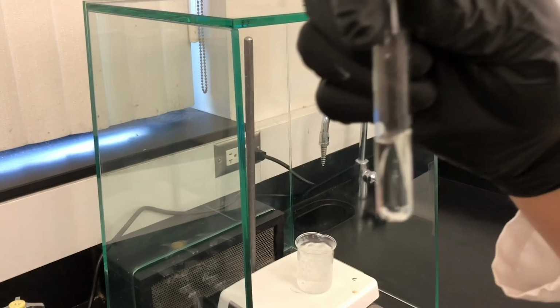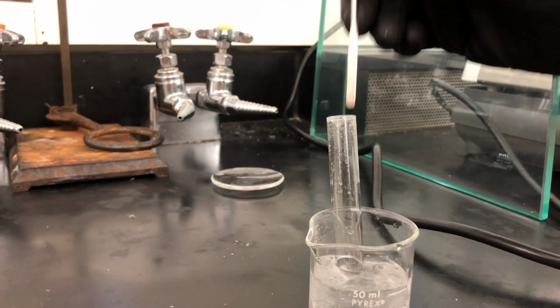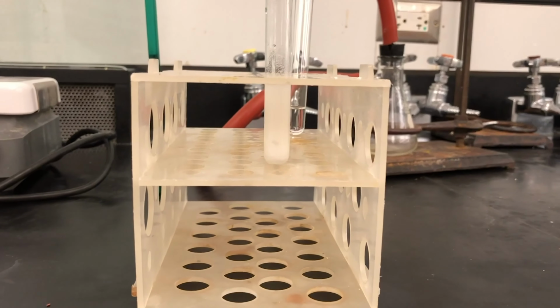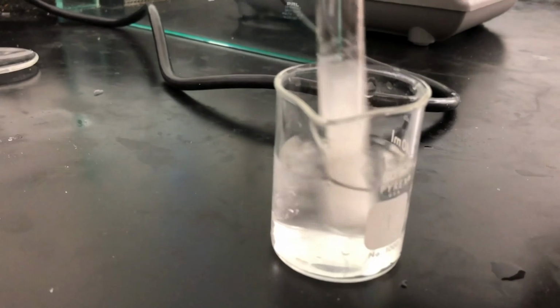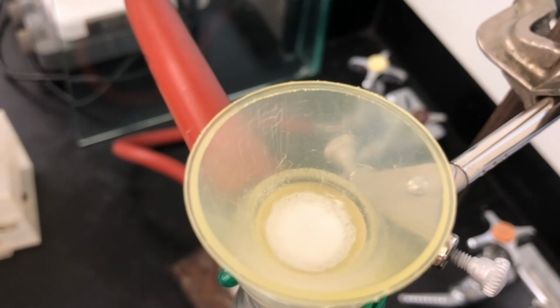Once it is dissolved, place it in ice-cold water to test for precipitation. Once it precipitates, you can use the boiling hot water to dissolve it again. And now let it recrystallize at room temperature. After 5 or 10 minutes, you can place it in ice-cold water to obtain any last formations, and then filter it using the Hirsch funnel. The test tube can be rinsed with ice-cold water to obtain as much product as possible.